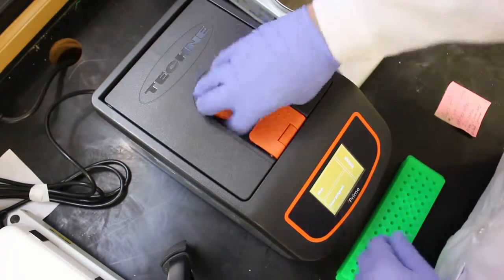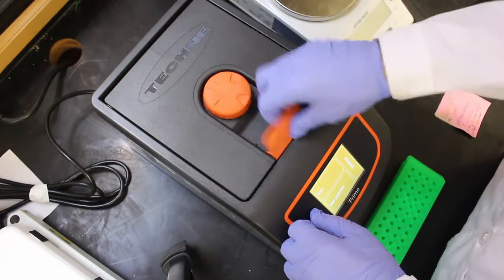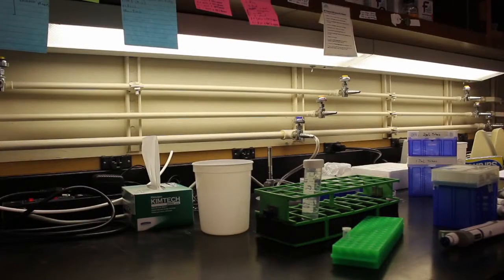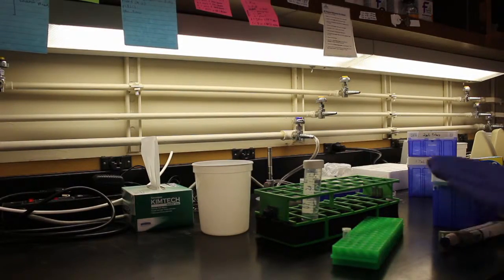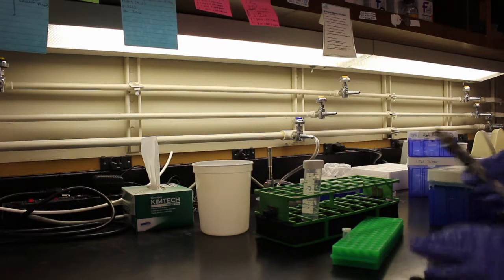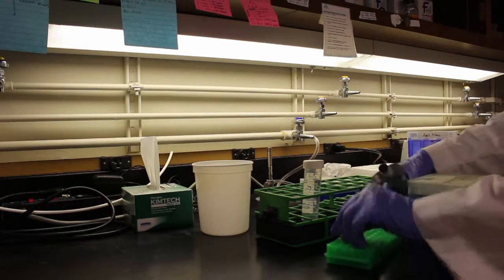Incubate at room temperature for 30 minutes and then heat inactivate at 80 degrees Celsius for 20 minutes. At this point, 3A assembly is complete. You can now transform competent cells in antibiotic-containing media and see the results of your newly constructed part.